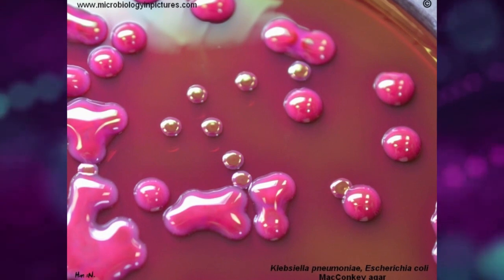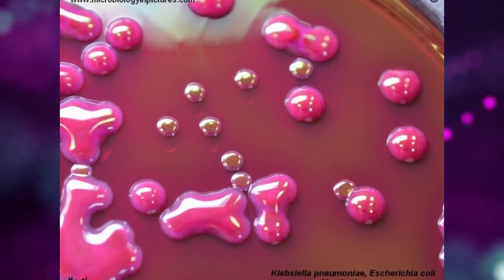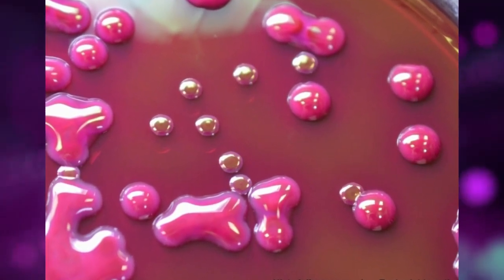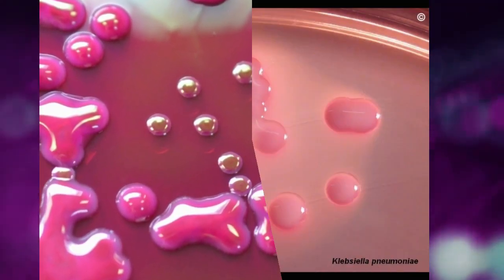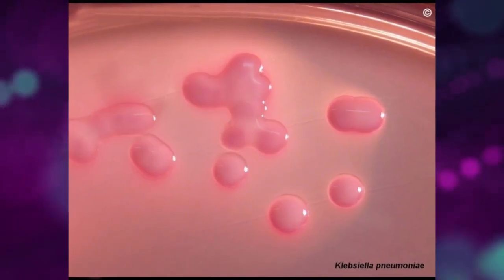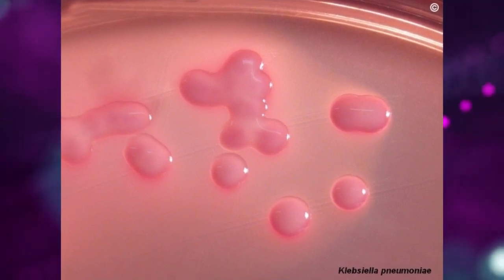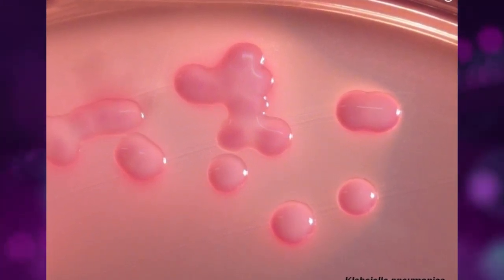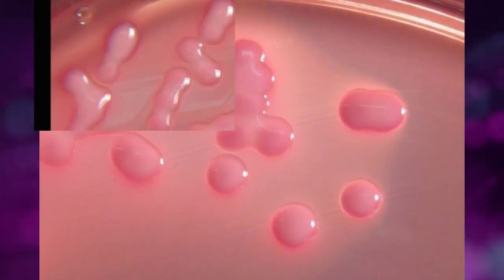Most strains ferment lactose, and their colonies on MacConkey medium are pink, though this color may not be clearly apparent in very mucoid colonies.